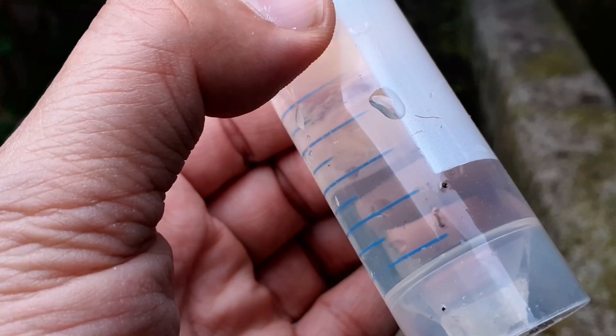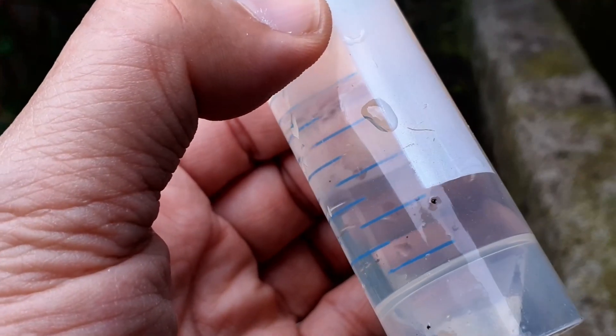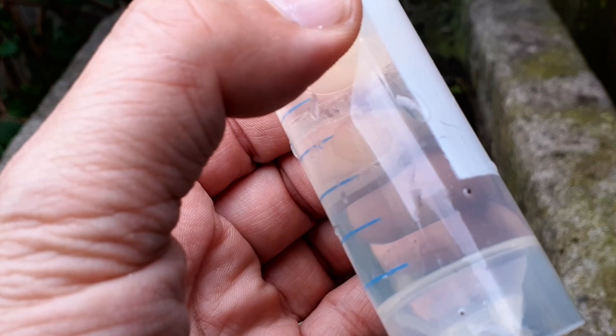Now I caught around four, five, or six larvae and I see that they're pretty large, really. I don't know, maybe eight millimeters in length even, and that's pretty large. I would say even too large to put on a normal microscope slide.